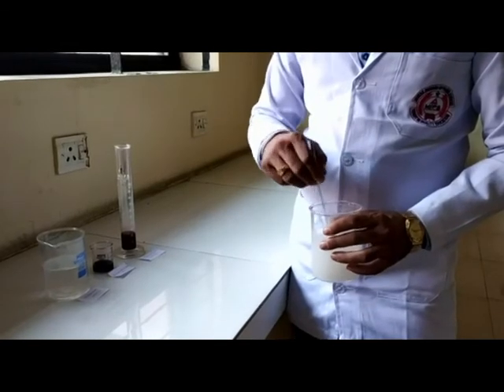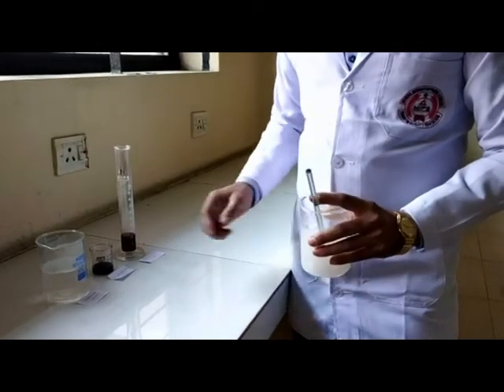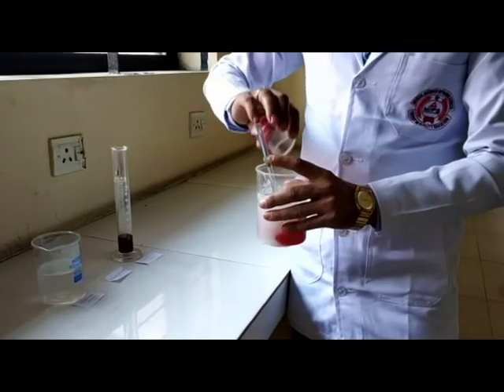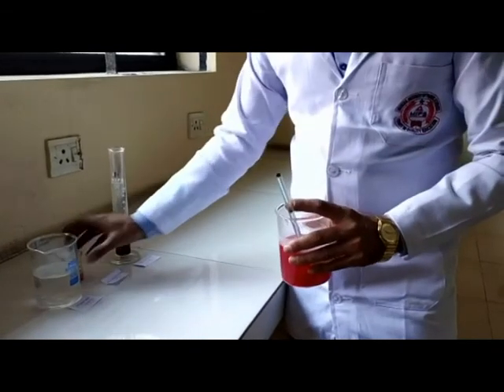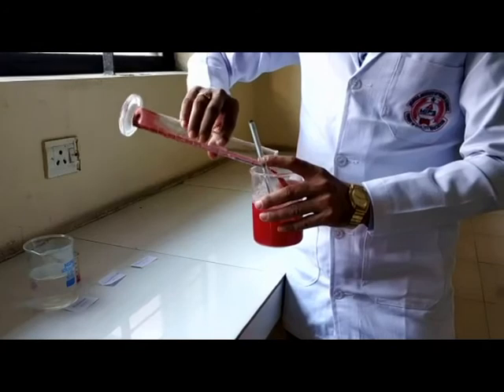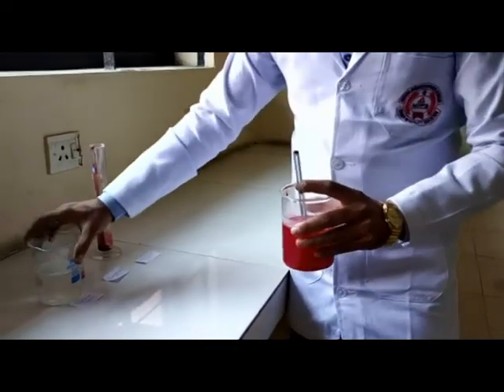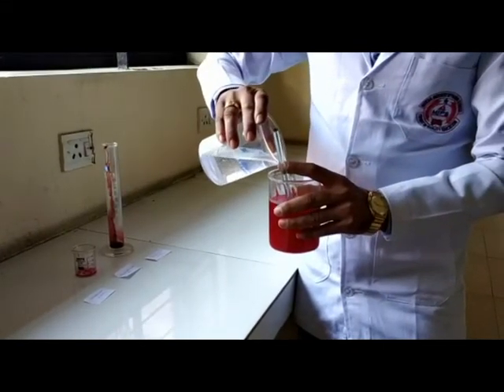With continuous stirring, to the above prepared solution we add the remaining ingredients: amaranth solution 2 ml, raspberry juice 25 ml, and a part of the invert syrup.